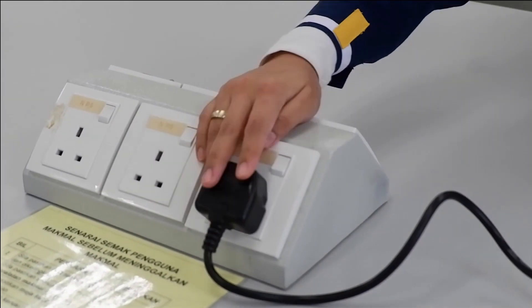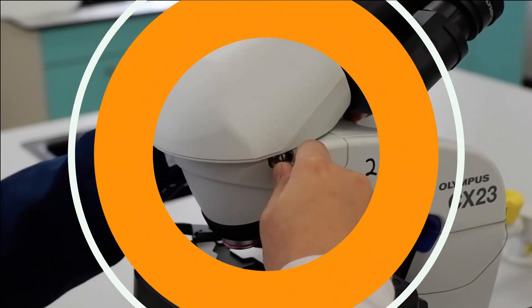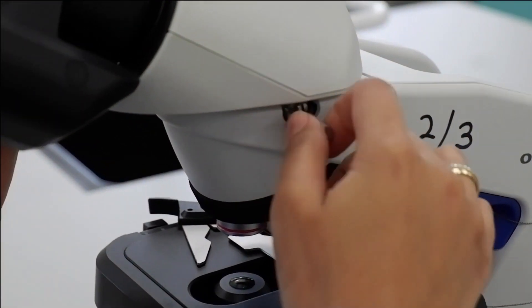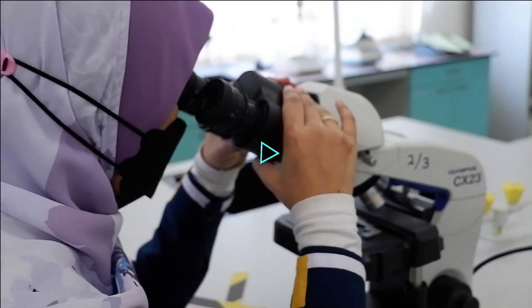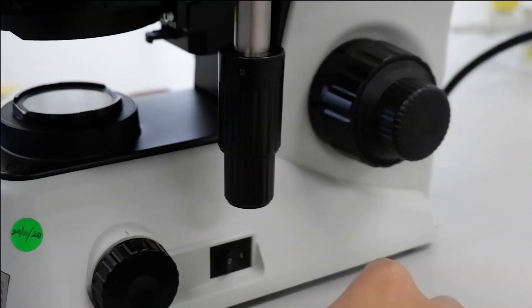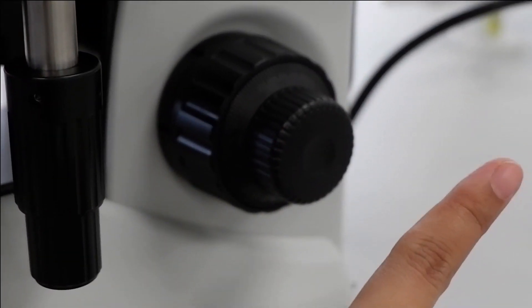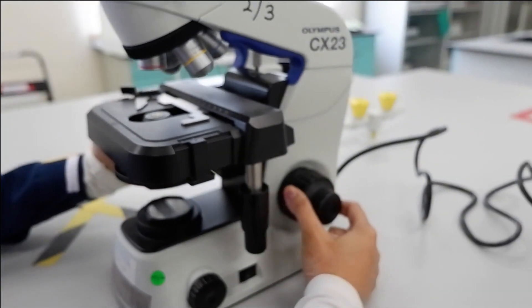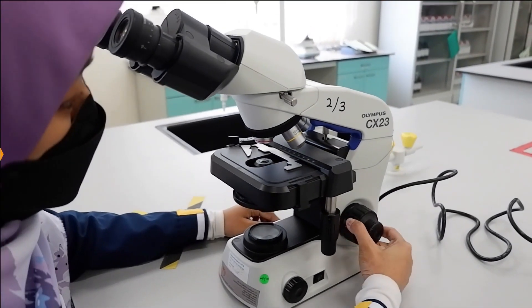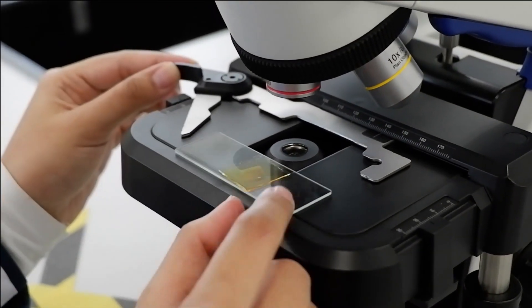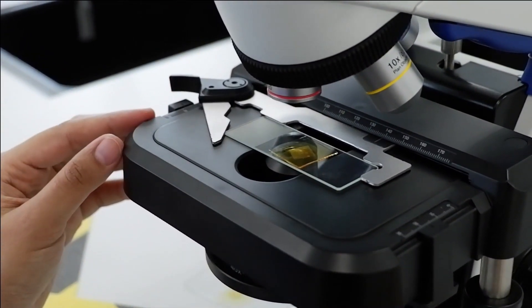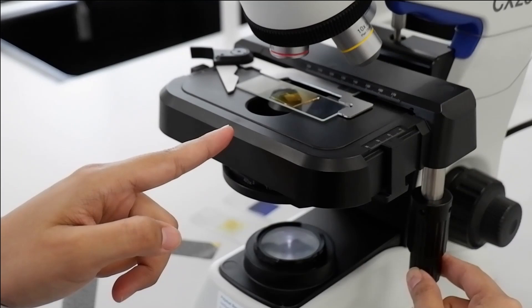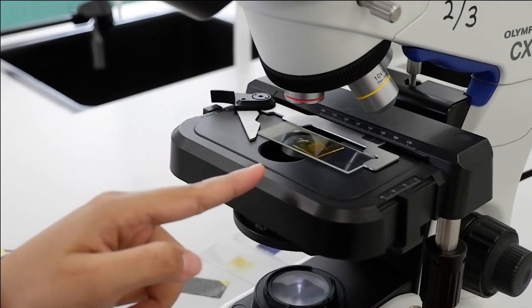Unwind the electrical cable and turn on the electrical power of the microscope. Unscrew the ocular lens and remember to adjust it to the placement of your eyes. Switch on the microscope and remember do not use the fine focus knob. Use coarse knob to adjust the stage so that the stage is at the highest position. Place the specimen slide on the stage and secure with slide holder. We will start off with onion slide. You can see the stage knob can be adjusted to move the slide front back or left and right.